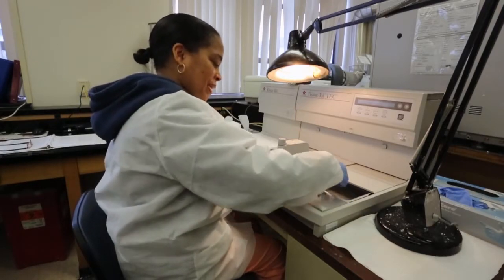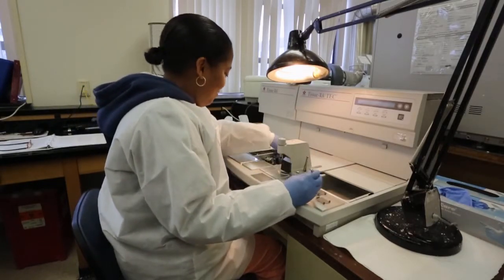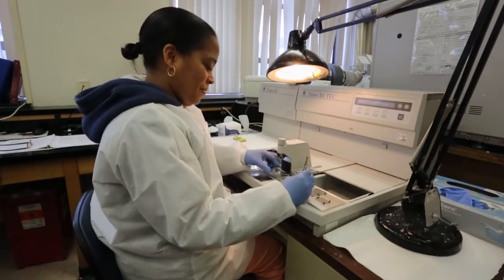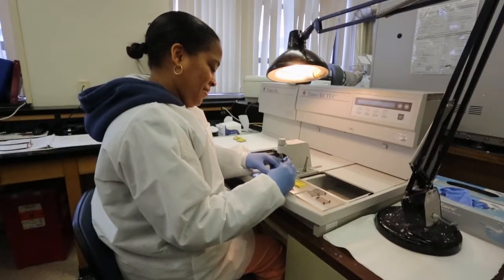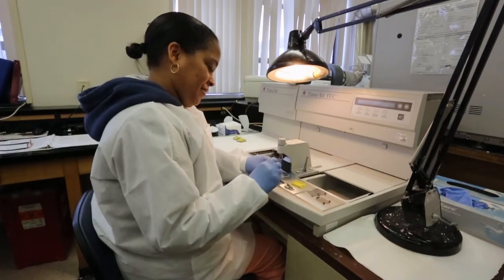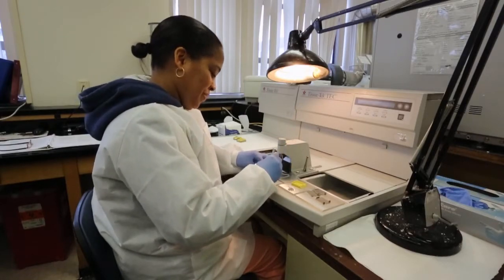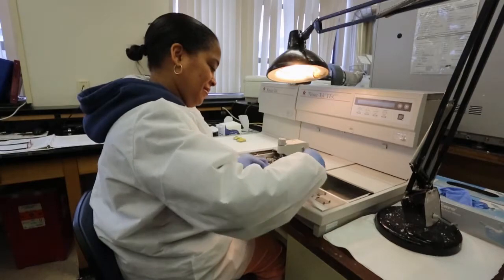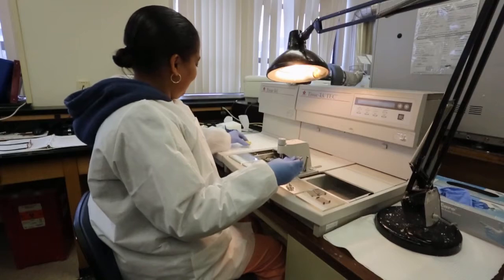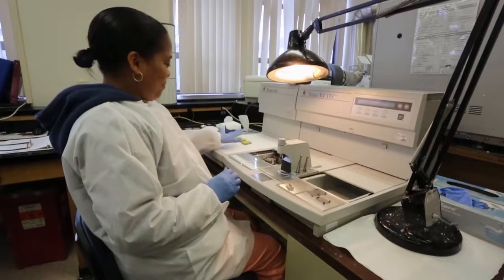This third block has three specimens in it, so I'll just use another medium sized mold. Line up the tissue and use the large tamper — push it down. And that's it.